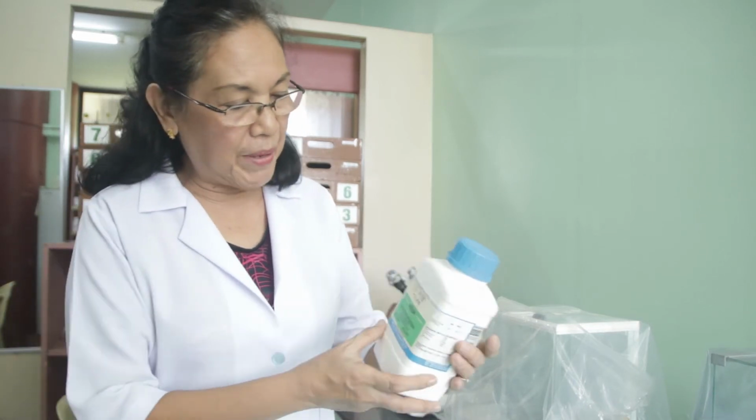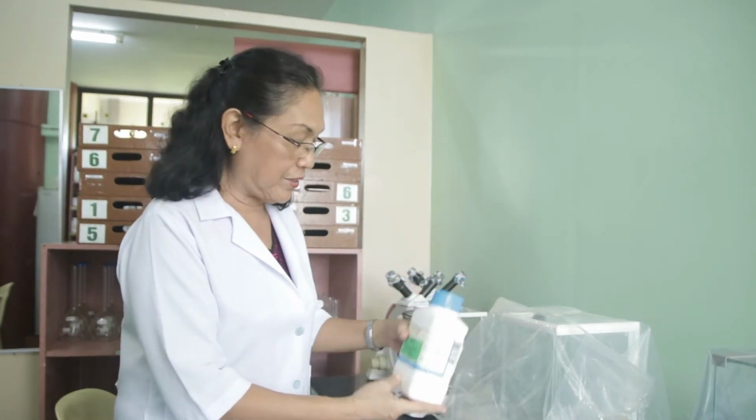Now, with those prepared laboratory reagents, we are going to standardize them, knowing the actual or exact molarity or concentration of those reagents that we have prepared. So this time, we are going to do activity number 12, standardization of the sodium hydroxide. We can standardize the sodium hydroxide solution with the use of the potassium hydrogen phthalate. This is the powder that we're going to use. We're going to use only about 0.3 grams of this powder.